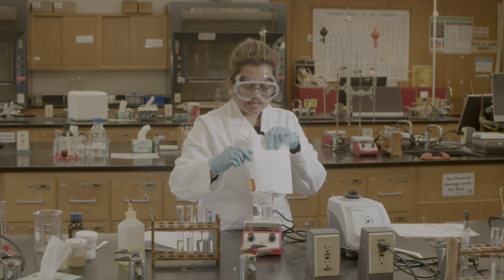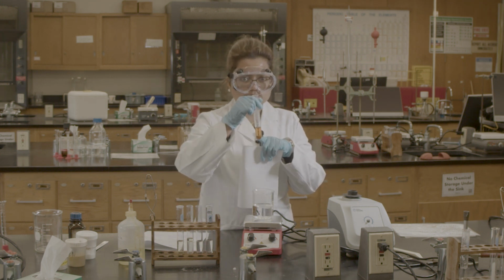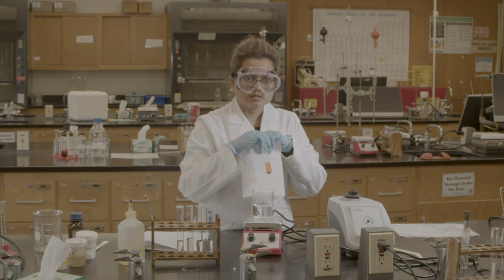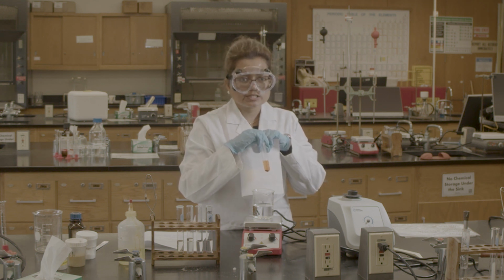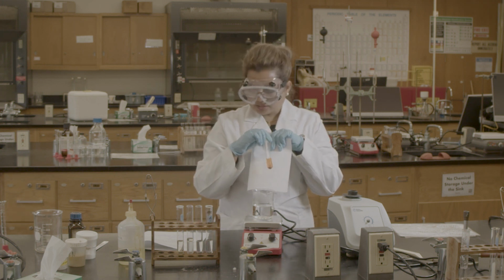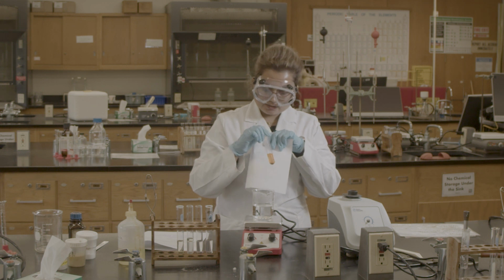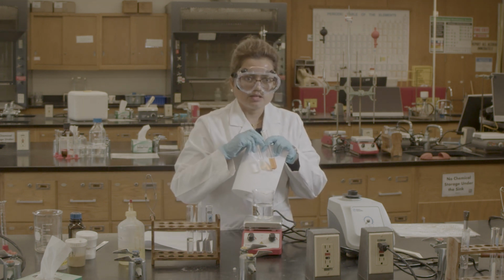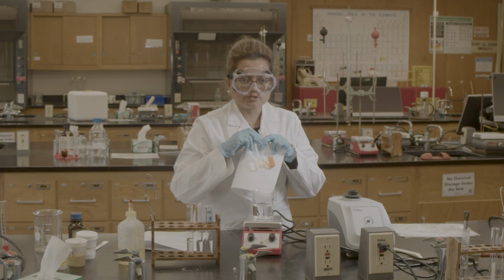Iodine, which had a chunk when it was in the cold water, you could see the chunk. Now you see it totally dissolved. As the temperature increases, it dissolves. Okay, the solubility increases. This is true for both the gelatin and the iodine. If the temperature increases, the solubility increases.